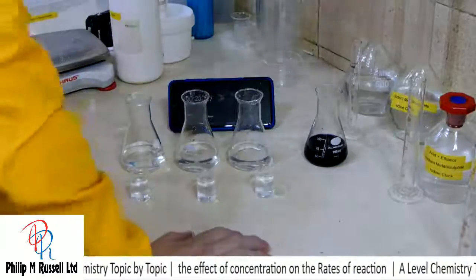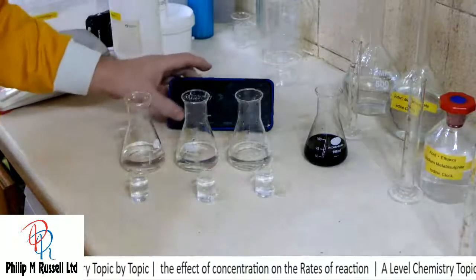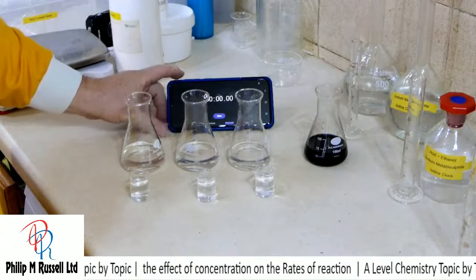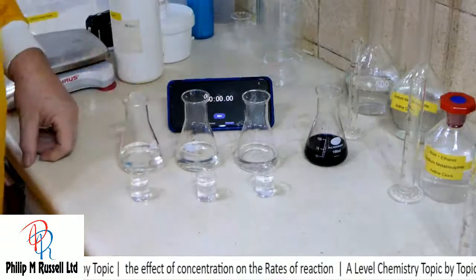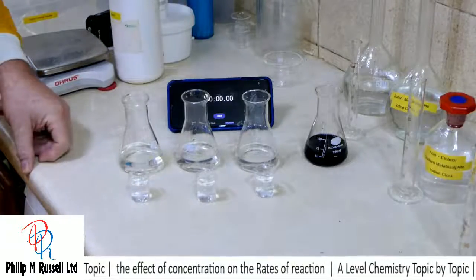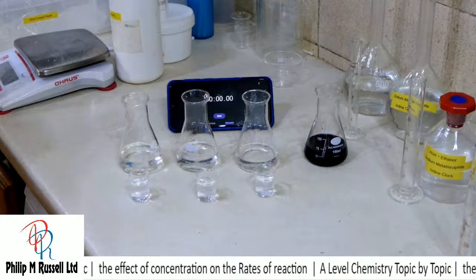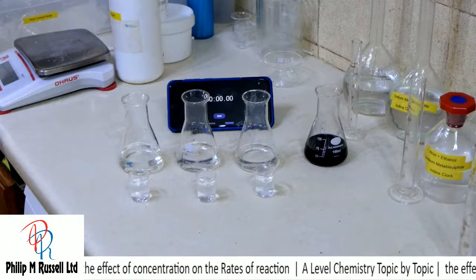Okay, well, we're not really going to need the stopwatch, but I will set the stopwatch going. And what we're going to do is we're going to put this in. Now, unfortunately for some of this, I actually do need 3 hands, and that makes life moderately difficult.